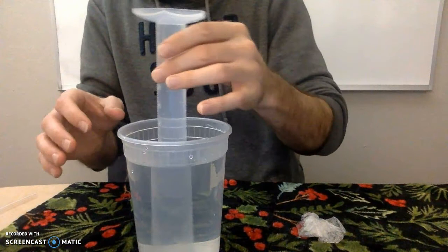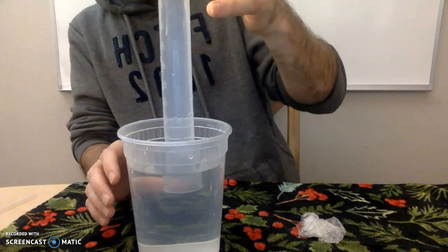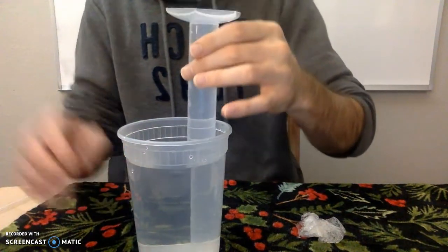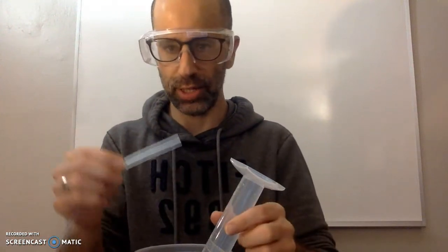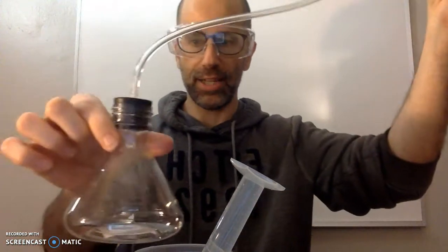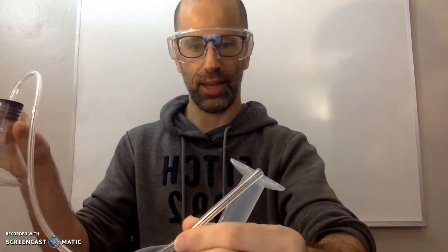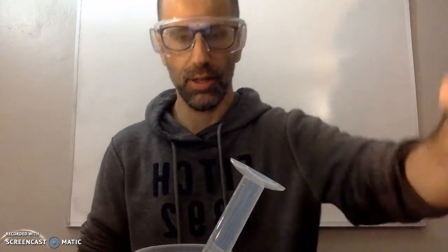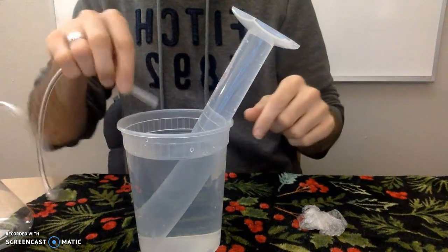That's how you do part two. You can lift the graduated cylinder up, but don't lift it above the water surface. The third part will be taking this end of the tube and putting it into the graduated cylinder — remember we've attached the other end to our Erlenmeyer flask. We need to get this end in there without losing the water. Join me next time for that.